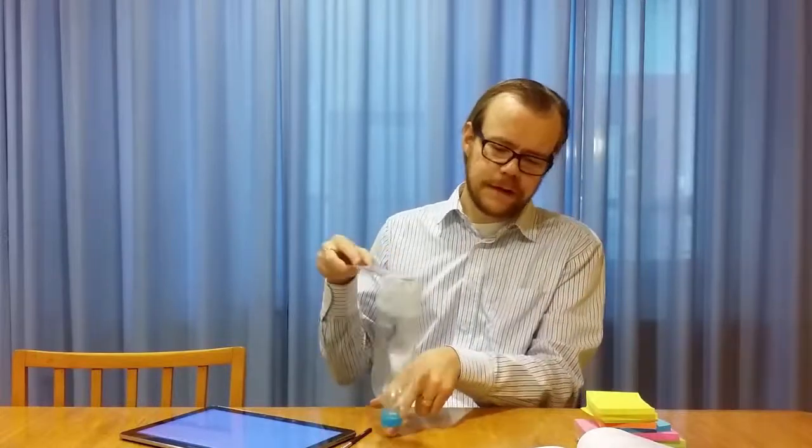Then we scan backwards, we put that in the backward image. And then the second line, we scan in the forward image. And then we go back, backward image. So we go forward and backward on the same track. And then we change position, forward and backward on the same track, forward and backward, and then we make this offset in the orthogonal direction. So then we get rid of this artifact of the piezo.